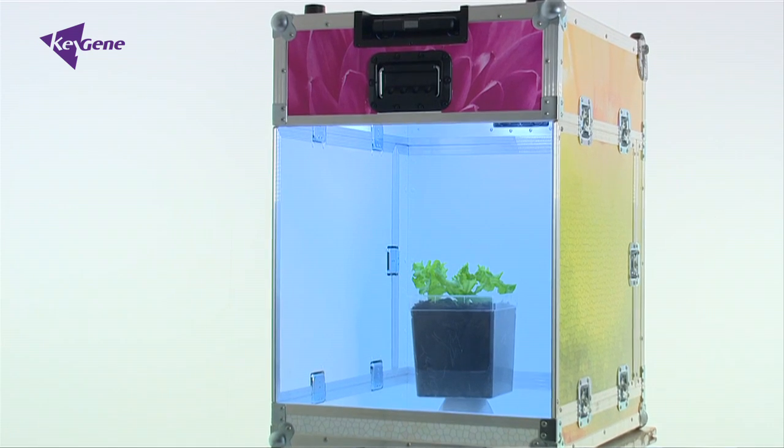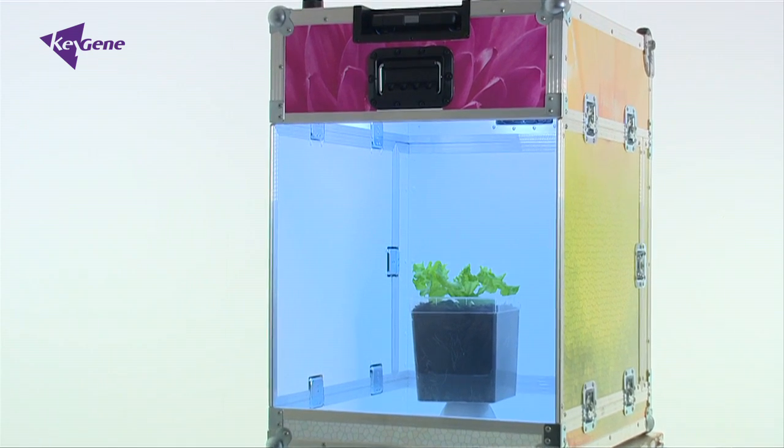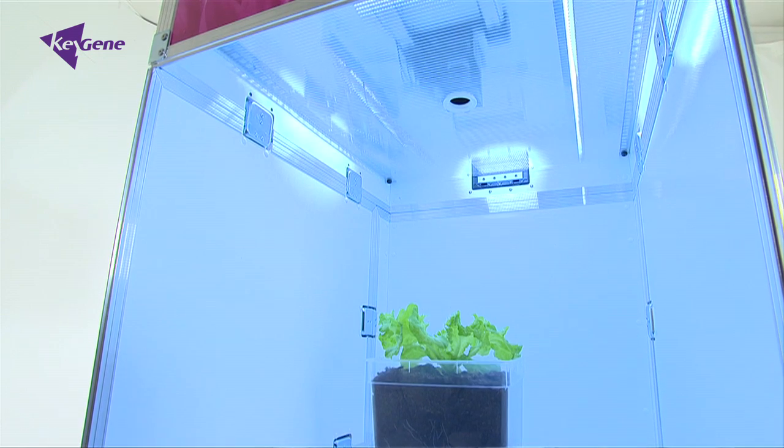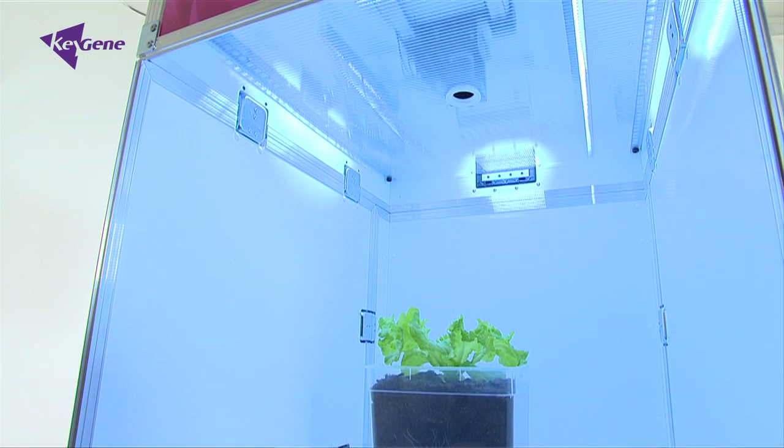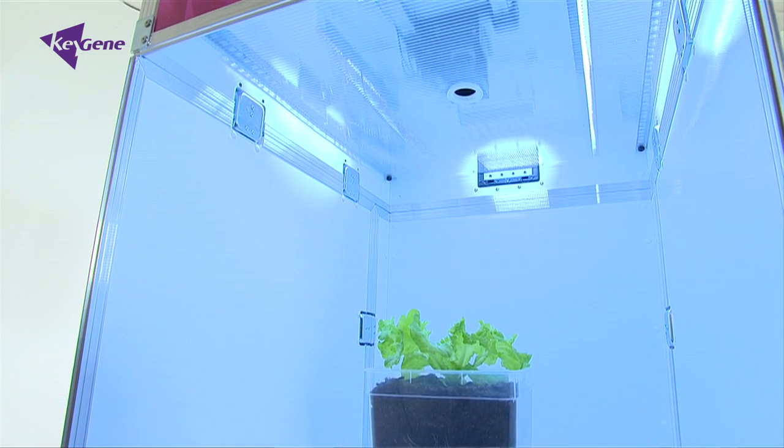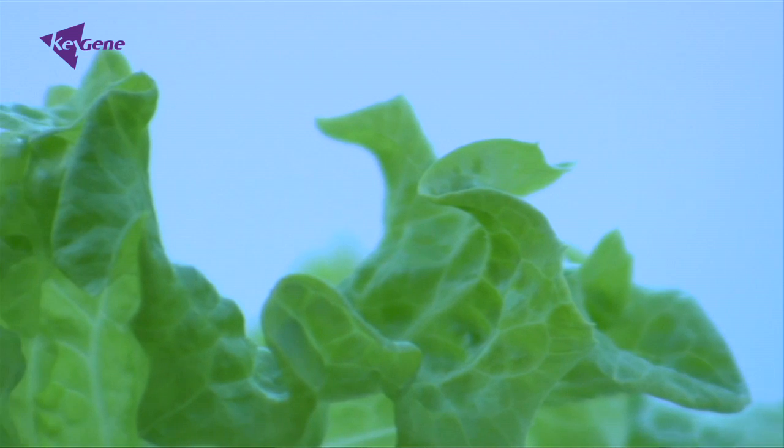That makes Keybox the ideal equipment to phenotype plants, trays, fruits, and leaves. Keybox is frequently used for disease phenotyping to assess the percentage of leaf area that's infected by the disease.